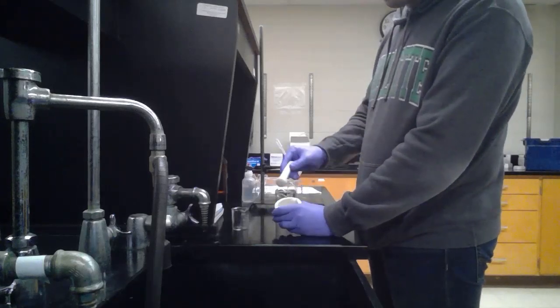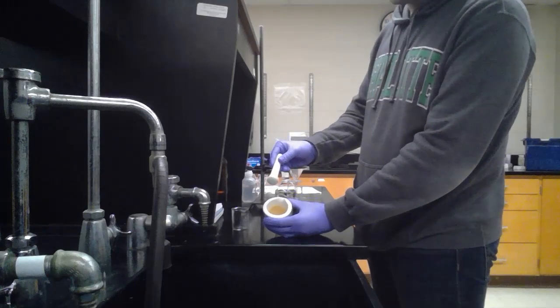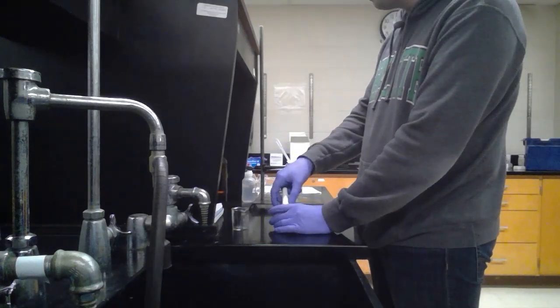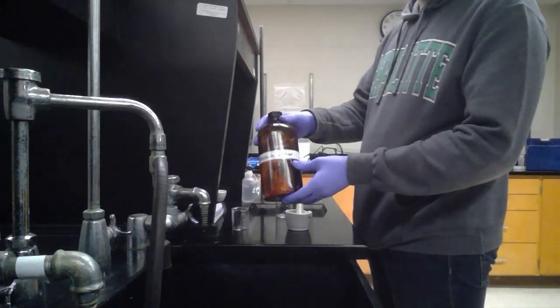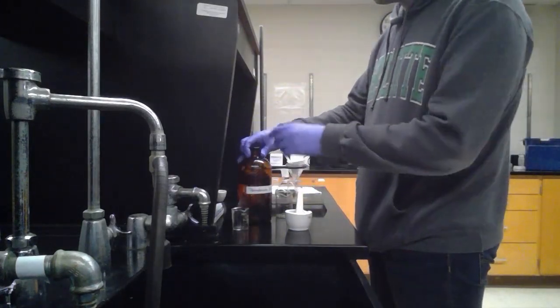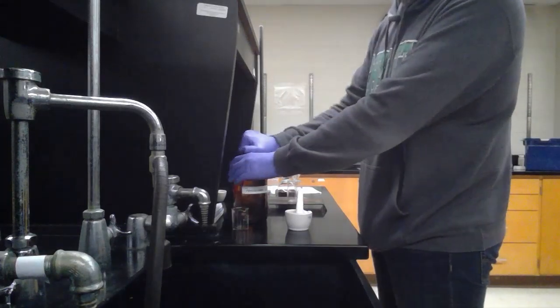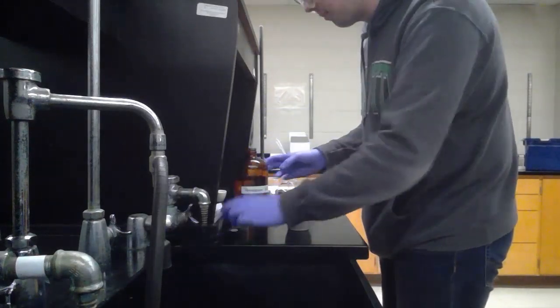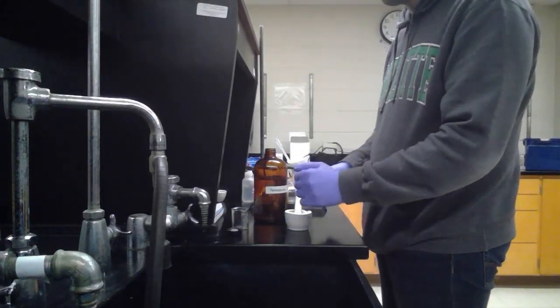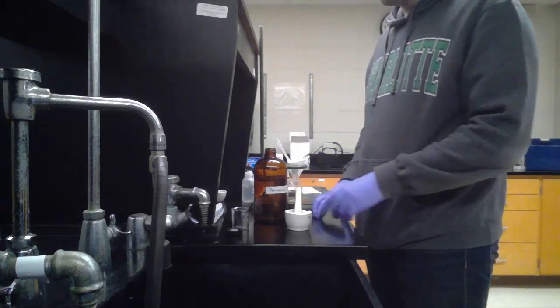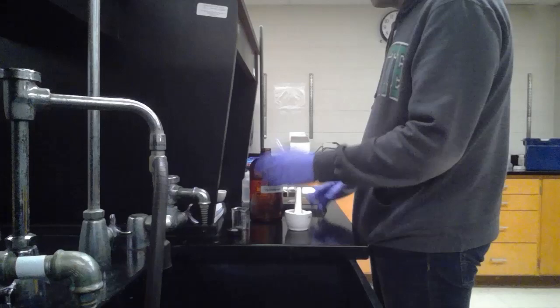Here I've got 5.23 grams of potato chips, and I've made sure to grind that up really well. The first thing we're going to do is wash it with some petroleum ether. Petroleum ether is a really non-polar solvent, so that's going to separate the fats from the starch and the salt that's going to be left over at the bottom that we'll use for later. We're not going to discard this, but we're going to wash this three times with petroleum ether.